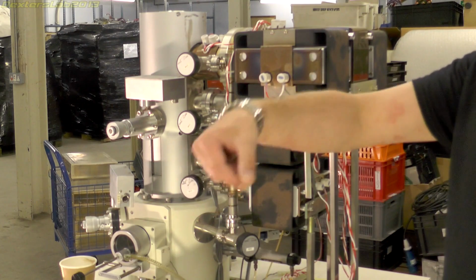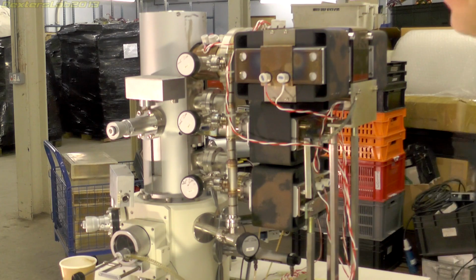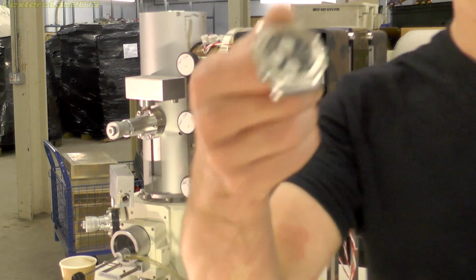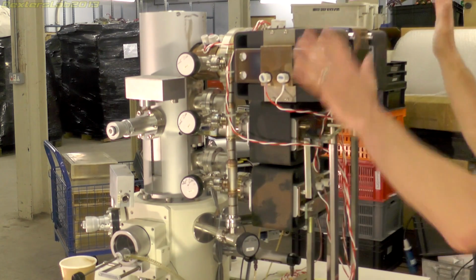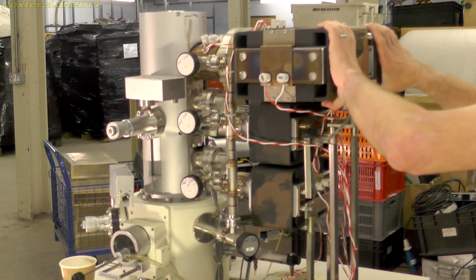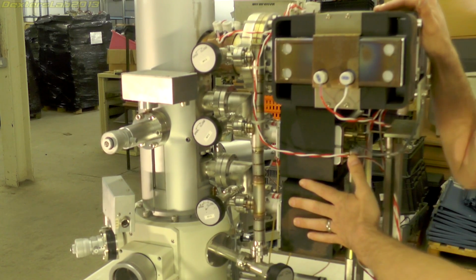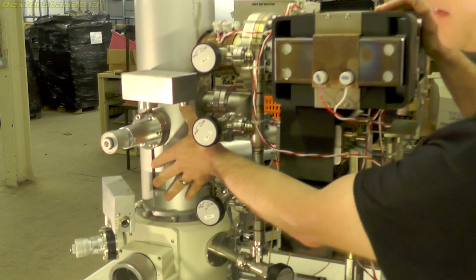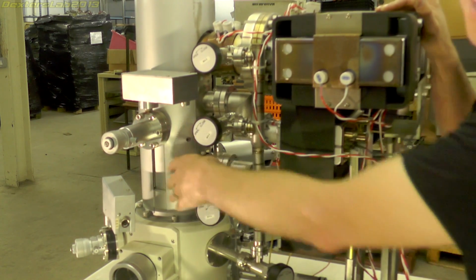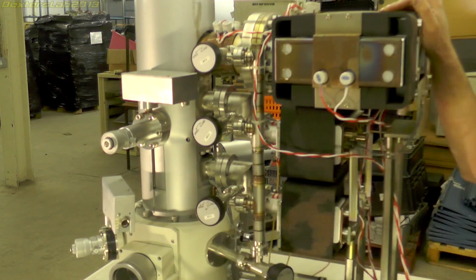Before I get started, I'm just going to take off my watch because these ion pumps, these parts here, are huge, great big magnets, so I don't want them screwing up my watch. So right at the top here, we have this large ion pump with two large magnets on the outside. And we have two smaller ion pumps that evacuate the two chambers in the final two stages of the column. And they're obviously all connected with these beautiful stainless steel pipes and fittings.